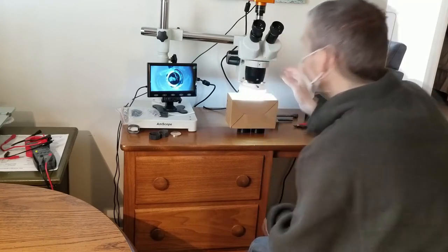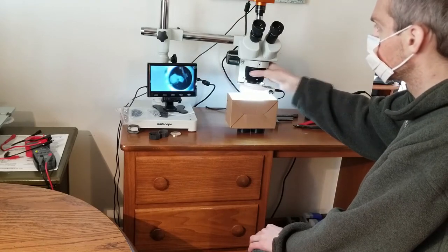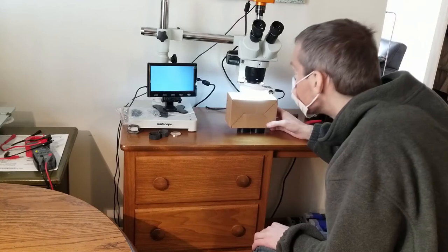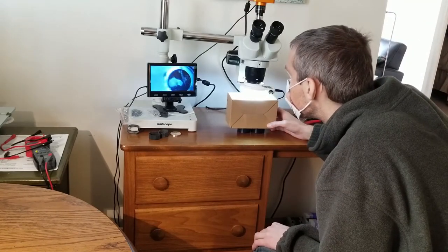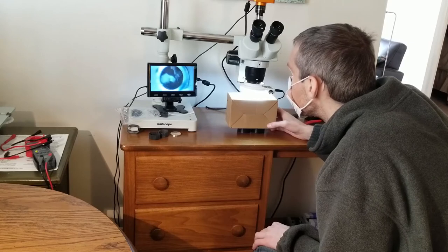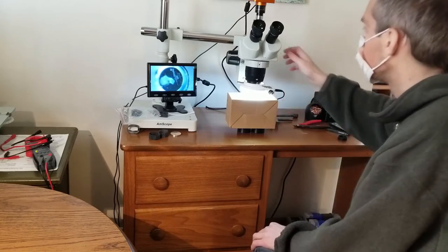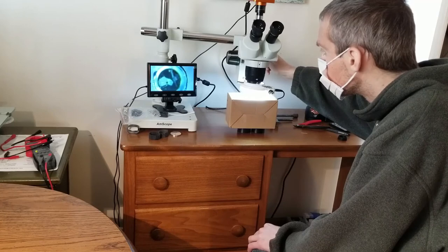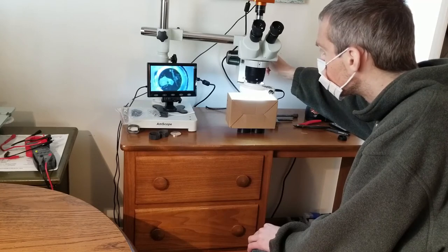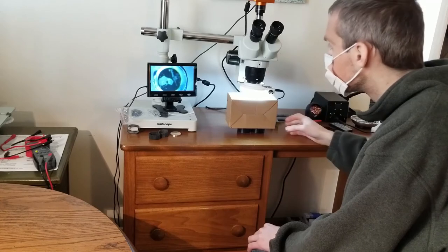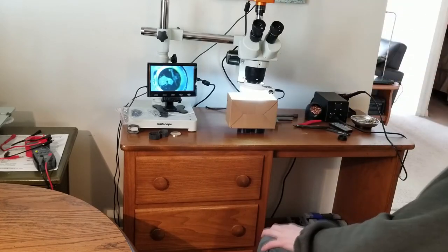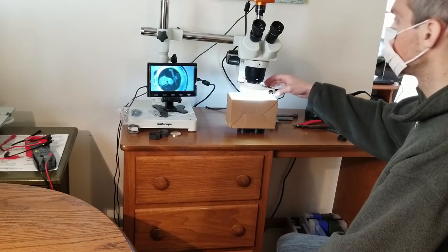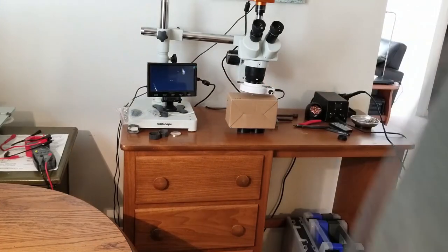One thing I did briefly look into was the possibility of using a beam splitter which would theoretically provide a light path for both the camera port as well as the eyepiece, eliminating the need for a moving lens. But because finding such a product that worked for this particular application would be extremely difficult, if not impossible, and require modification of the microscope that could lead to misalignment and possibly cause permanent damage, I decided it was not a route I wanted to explore much more.